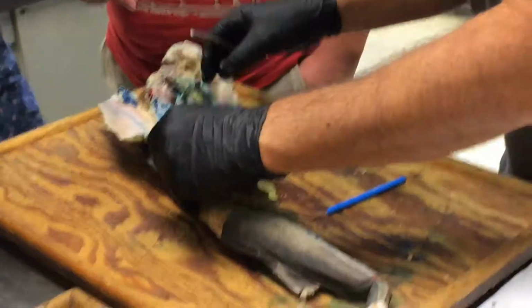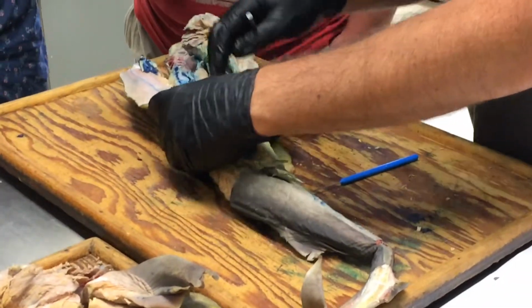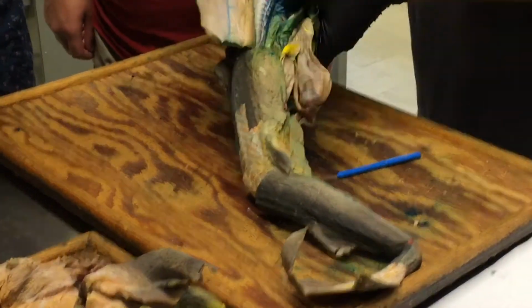I've exposed it a little. I mean, it's easily visible if you. Yours had it really good. Thank you, it's not here. I know, it's not here, sorry. I was just saying how good yours came out.